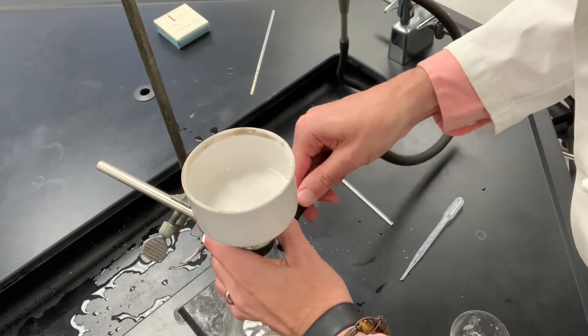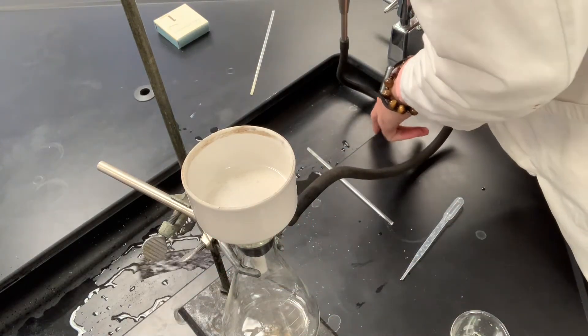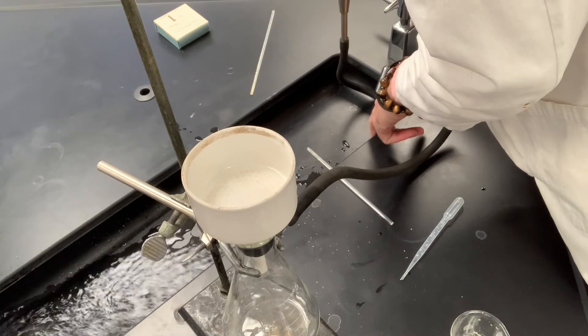Position the vacuum tubing here and start the vacuum.